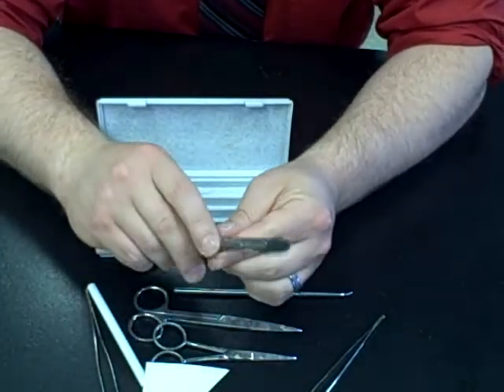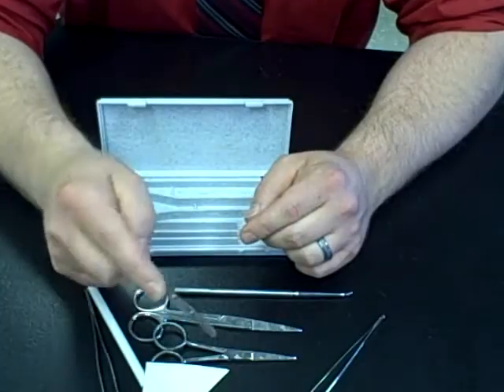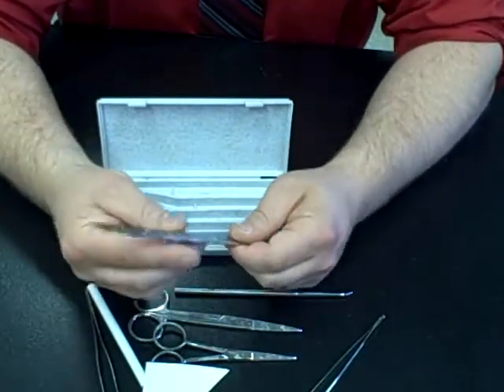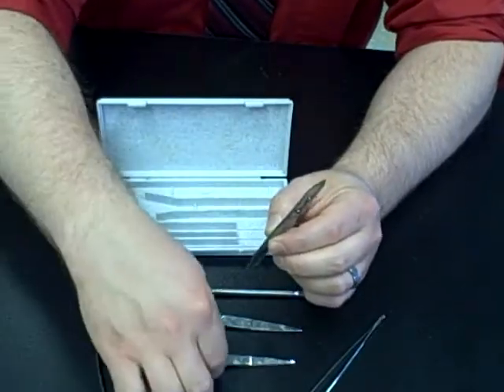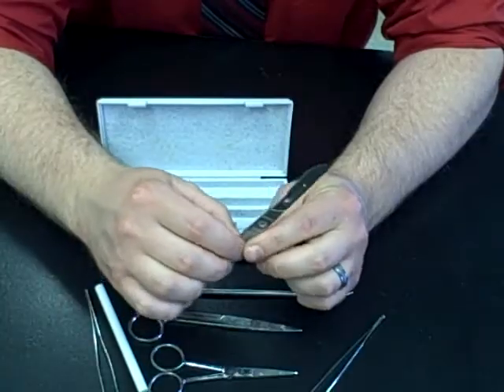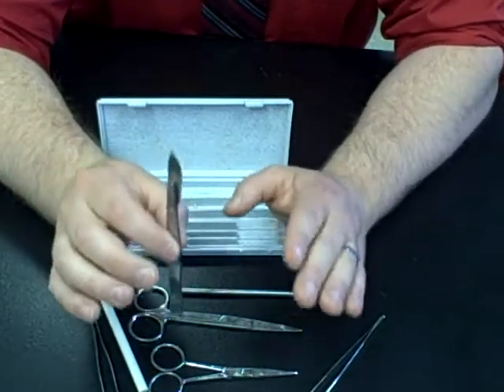Because of how sharp they are, you have to be very careful. The proper form for holding this is with your index finger sort of on the spine, and then the base of the scalpel pushing into your palm to give you a nice steady platform from which to cut. You always cut away from yourself and away from your lab partners. Truthfully, you don't need this very much — most of the dissections you can get away with using scissors, which are actually much more precise. But for certain steps in the rat dissection, you will need to use the scalpel, and it will only show up in your kit for that last one.